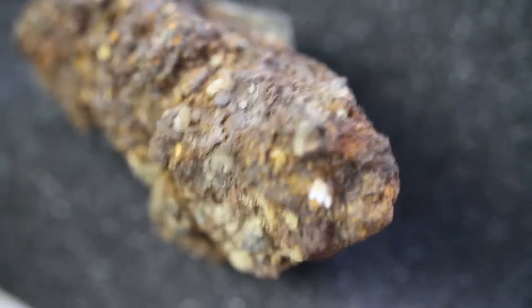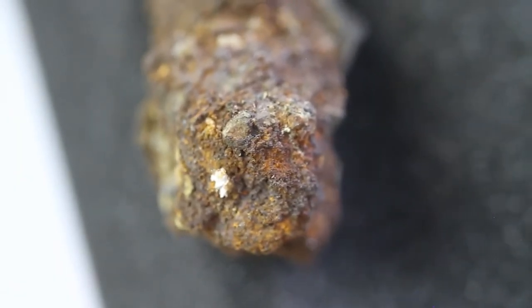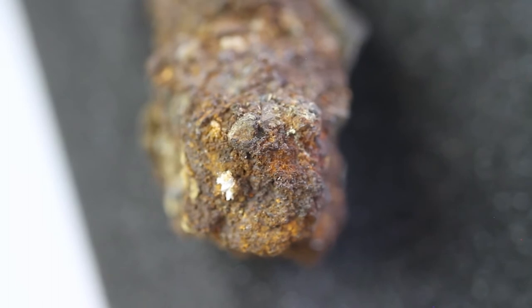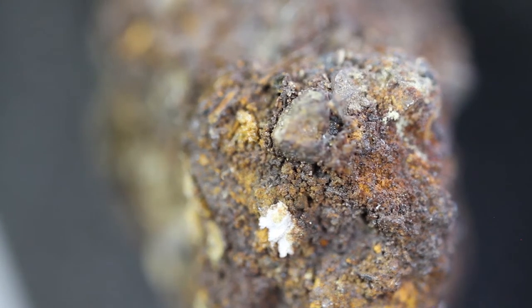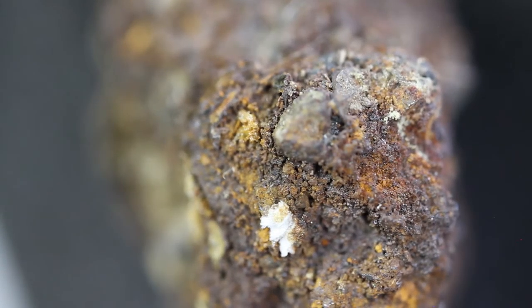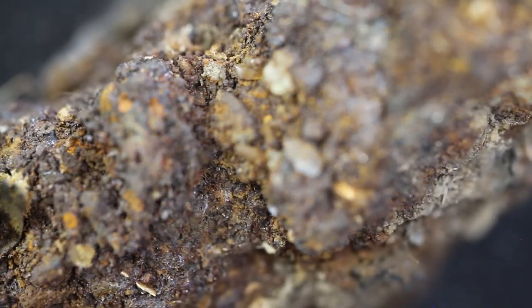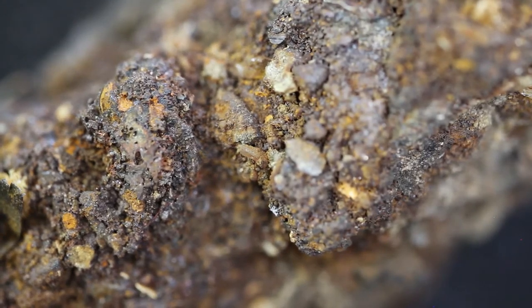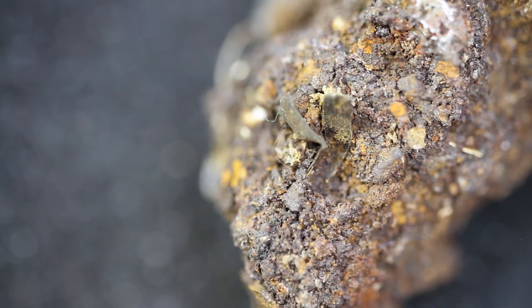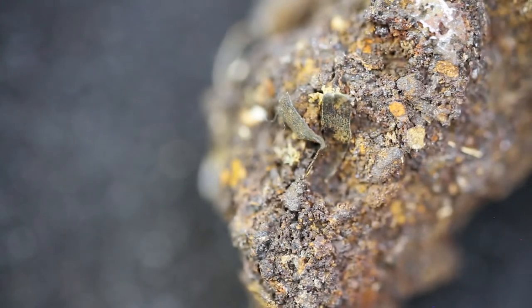I'm going to try and crack out the microscope and try to get some really close shots of this material. Here you can see some polymer strands caught in this agglomeration.